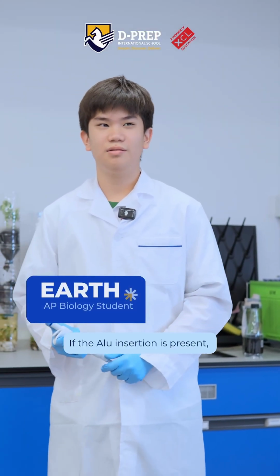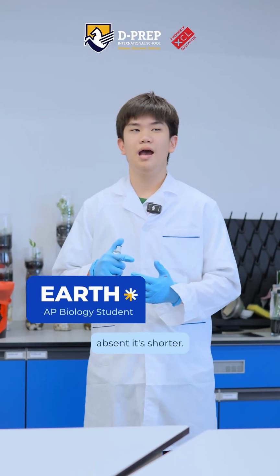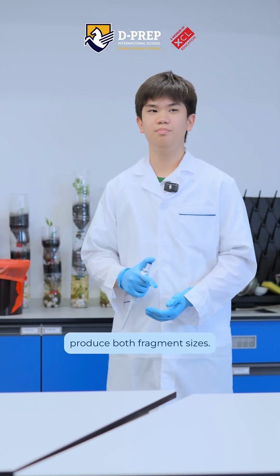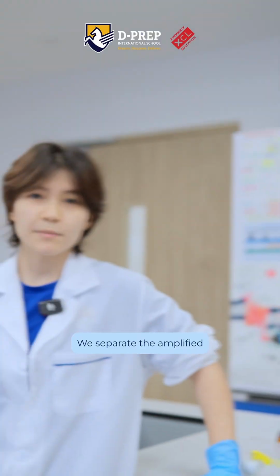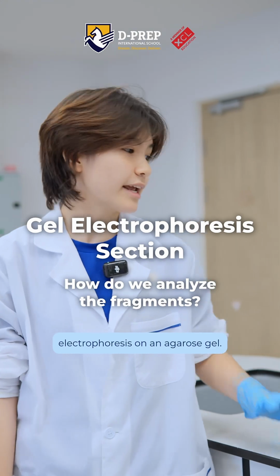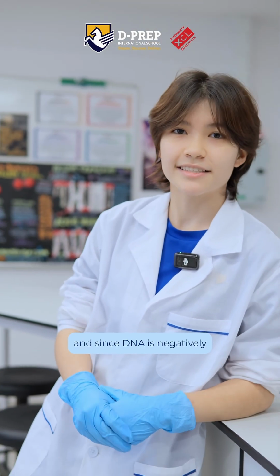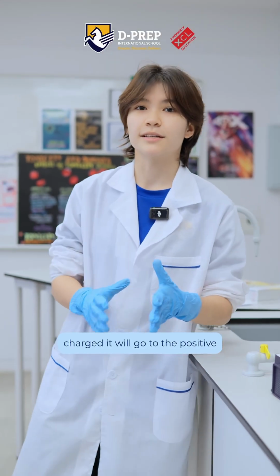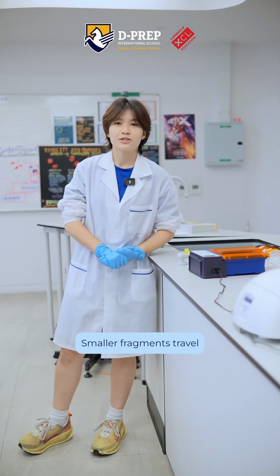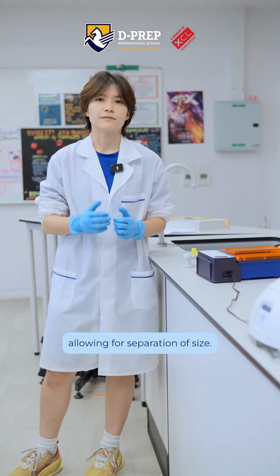If the Alu insertion is present, the amplified DNA is longer. If absent, it's shorter. Heterozygous individuals will produce both fragment sizes. We separate the amplified DNA fragments by using electrophoresis on an agarose gel. An electric current is then applied, and since DNA is negatively charged, it will go to the positive electrode. Smaller fragments travel farther than larger fragments, allowing for separation by size.